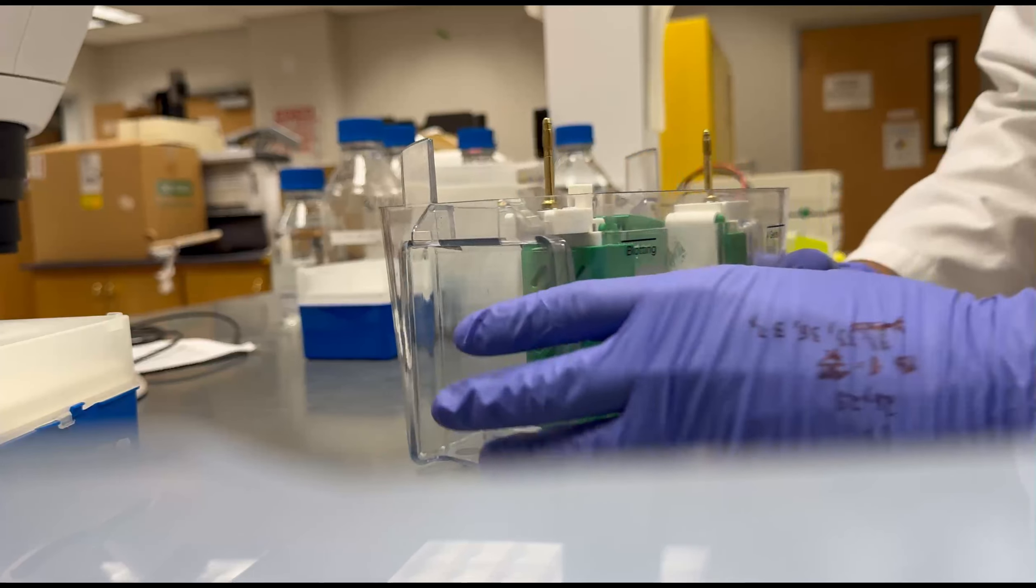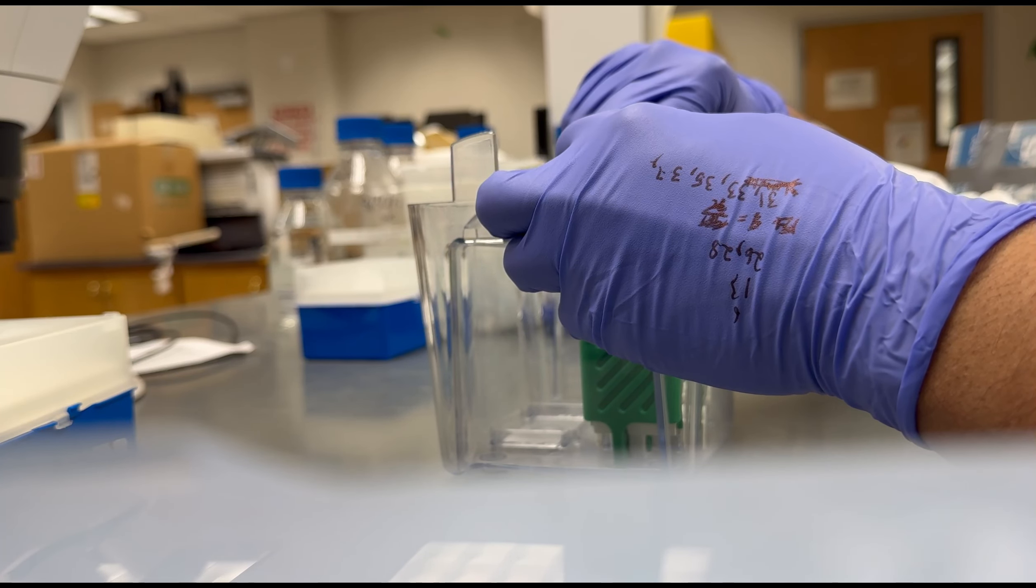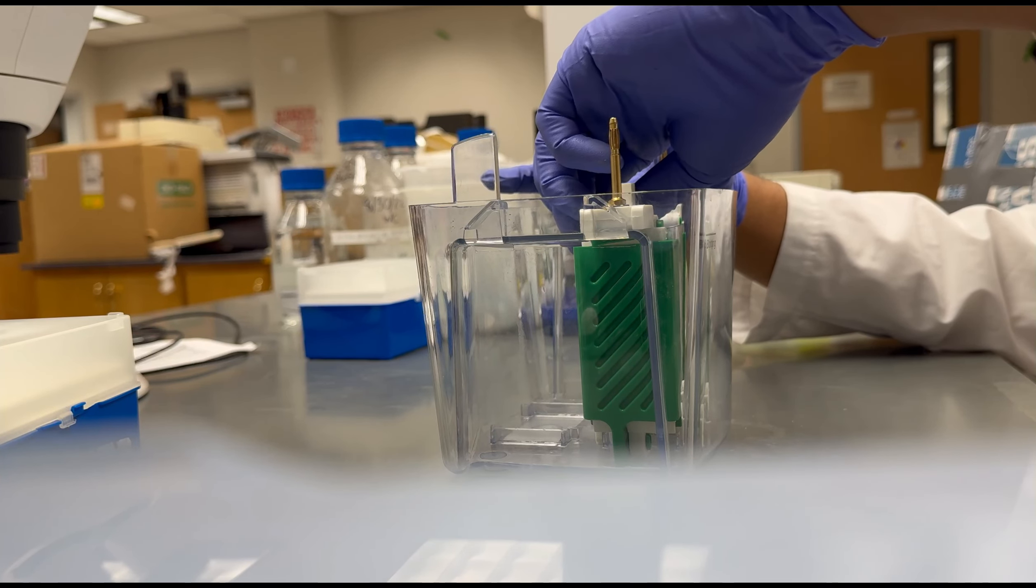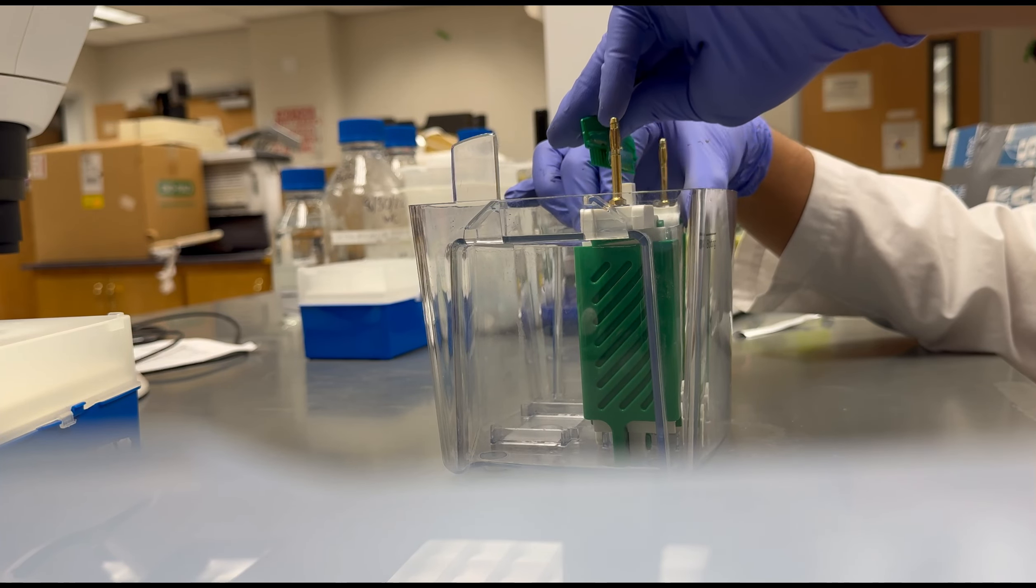Either before or after filling the chambers with buffer, the comb of the gel must be removed. This will give us the space to allow us to pipette our samples onto the gel.